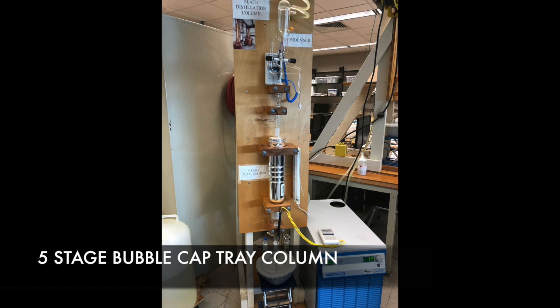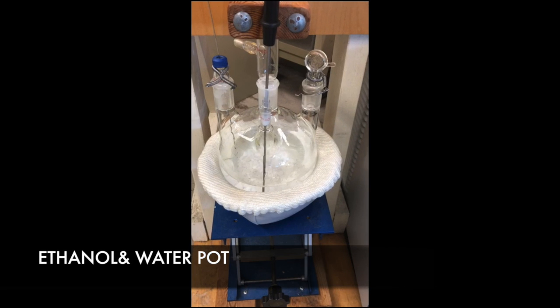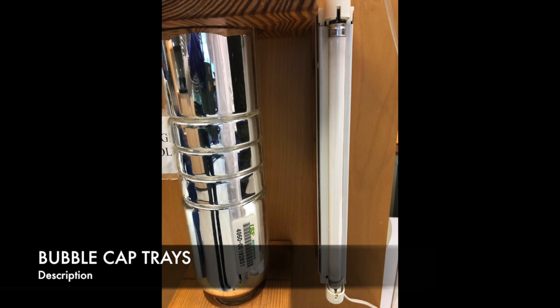Here is the full setup of our distillation equipment. The pot here contains the mixture of ethanol and water, and inside of it is the thermocouple that is used to measure the temperature of the system. Here what we can see is the 5-stage plate column. What you may not be able to see from this view is that the trays being used are bubble cap trays.